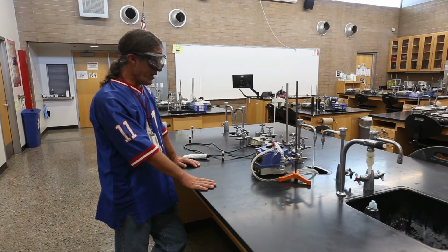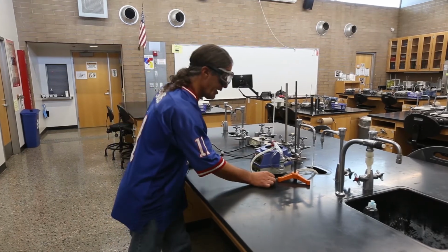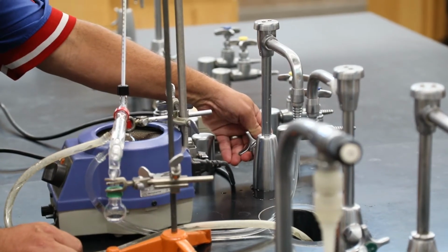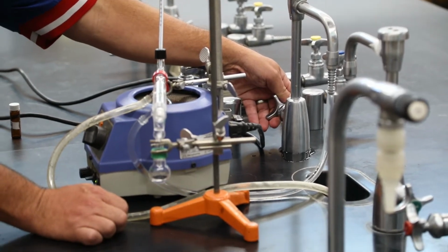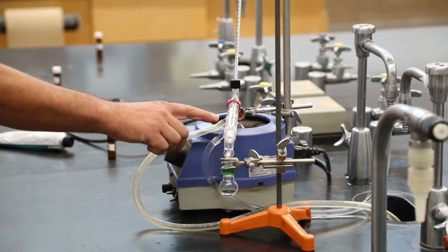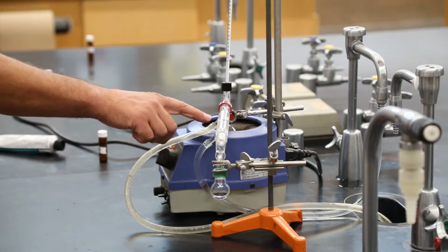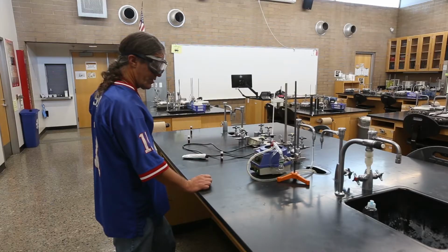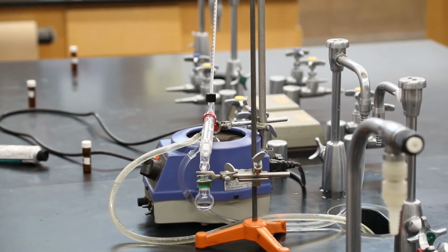Again, this is something where we want to be attentive, make sure everything's going as it should be, make sure every once in a while to check to see if the water is still flowing. These valves tend to shut themselves off a little bit if you try to go with a very low flow, and that's what this one did. This amount of water provides really efficient cooling, so even if the water shuts off for a little bit, it's still going to be cooling here until this water warms up. So we caught it in time and restarted the flow. The dripping is nice and constant here, very smooth.